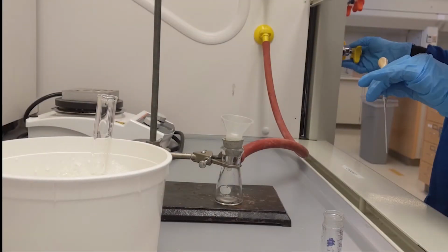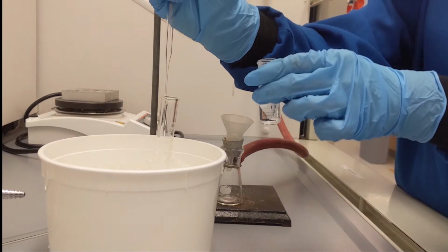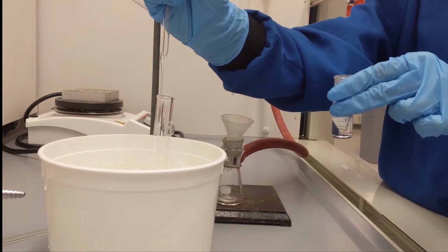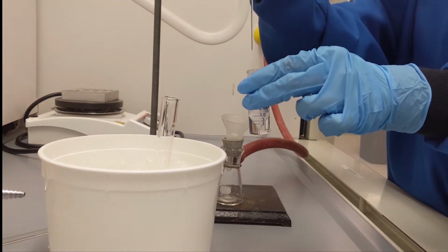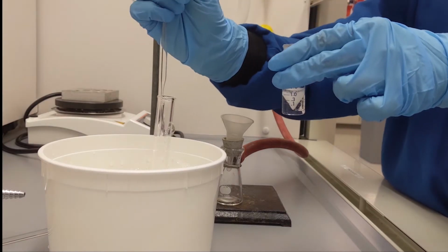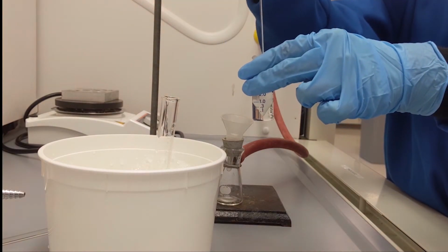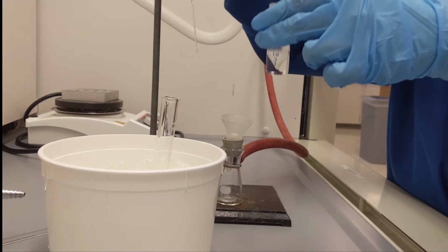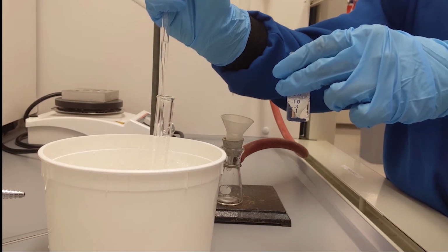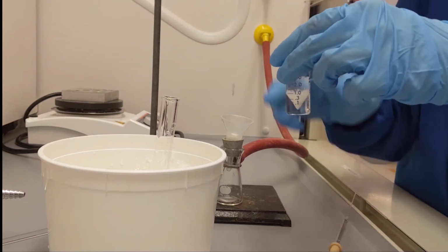Along with your conical vial, put some amount of distilled water into a graduated cylinder and place it into an ice bath to have cold water. And then add 3 milliliters of cold water into your vial and stir thoroughly. Proceed to collect your white solid by vacuum filtration. The filtration setup is prepared as was done in the previous experiments. Make sure to clamp it to a stand.